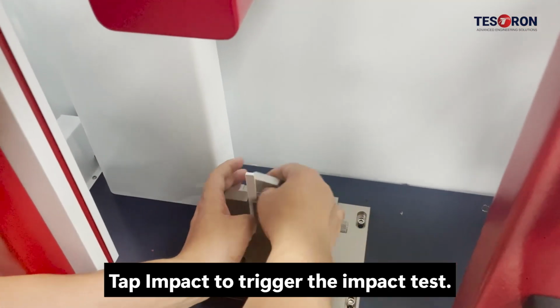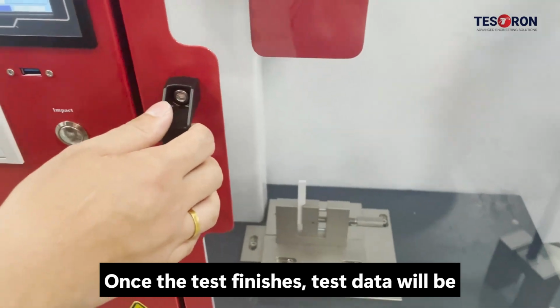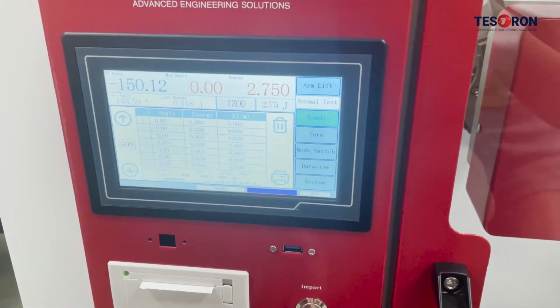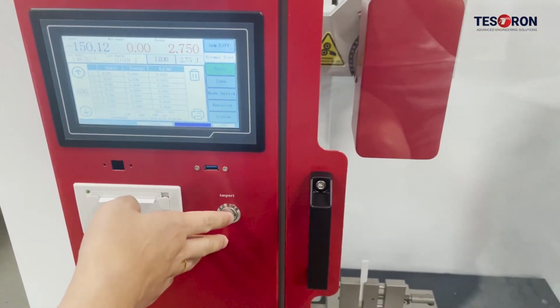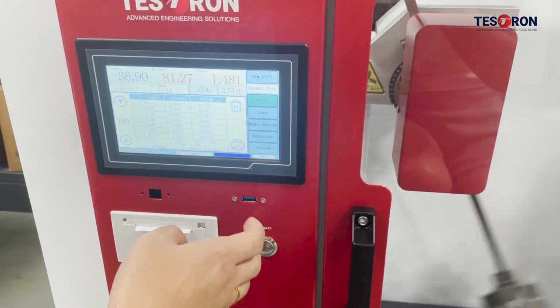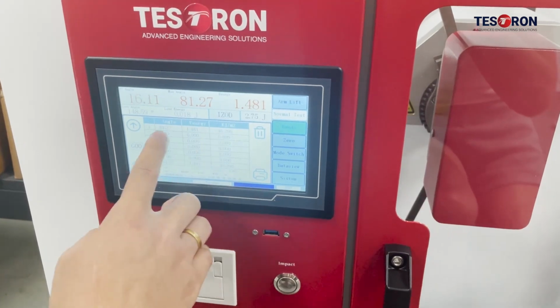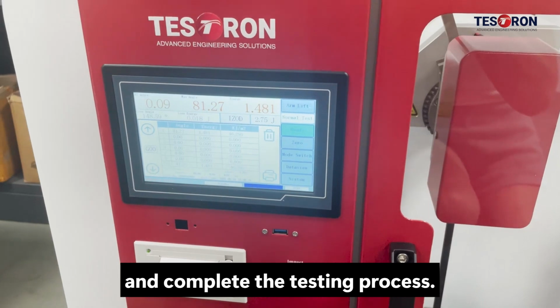Tap Impact to trigger the impact test. Once the test finishes, test data will be displayed on the screen. Tap Print Label to output the test report and complete the testing process.